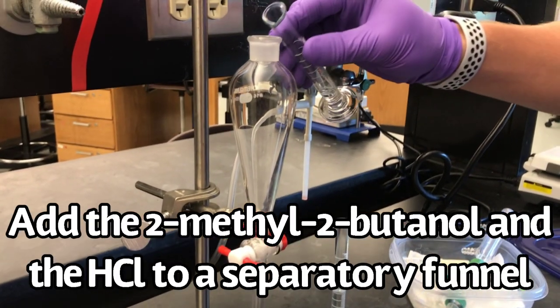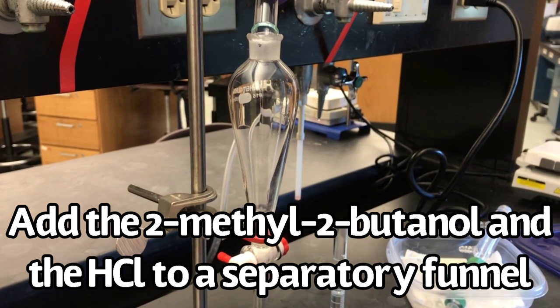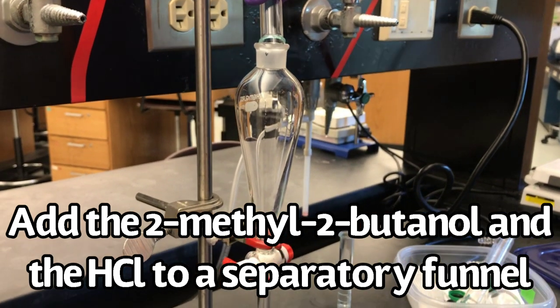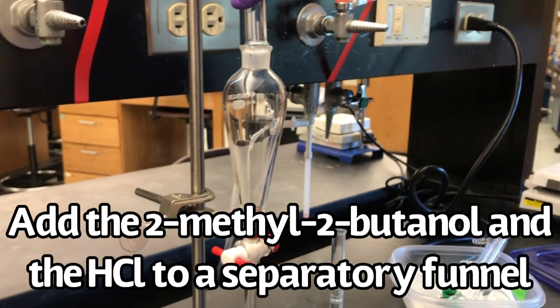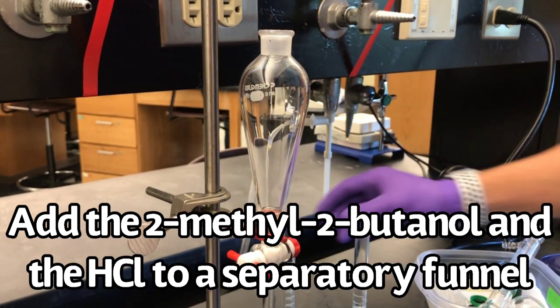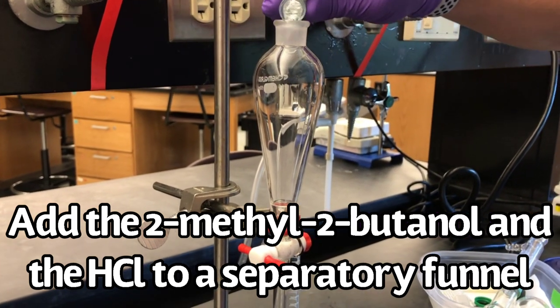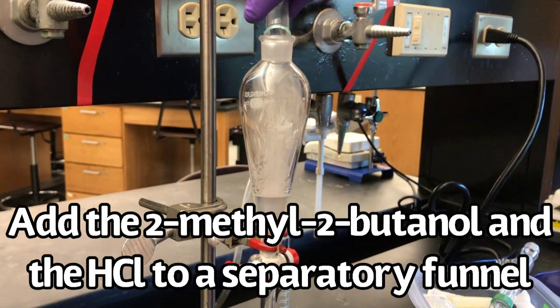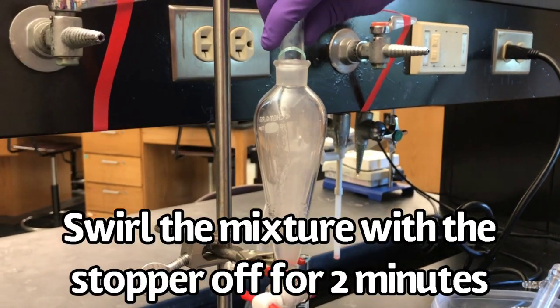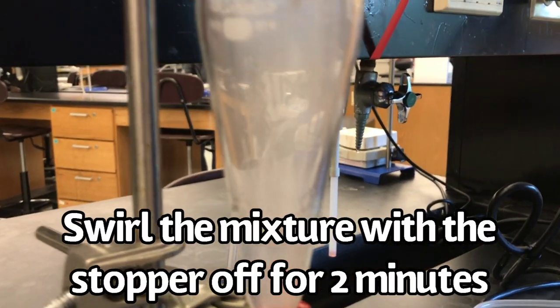Add both the 2-methyl-2-butanol and the concentrated hydrochloric acid to a separatory funnel and manually stir the solution with the stopper off. This reaction will produce a lot of gas, so the stopper must be off to allow the gas to escape. Swirl for 2 minutes to allow the reaction to proceed completely.